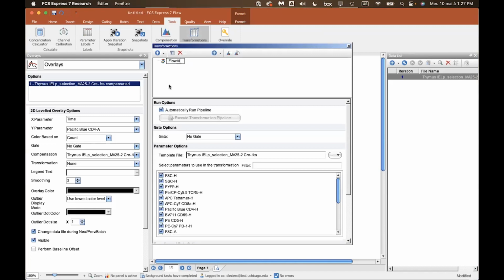We'll call this Flow AI. It's going to be applied to all of our samples. We could apply a specific gate. I don't have any gate right now. And a series of detectors or parameters that we have in our data file. Right now, I'll just apply to everything. Whenever you do your own analysis, you want to double check if you apply your algorithms in a way that makes sense to your optimal goal.